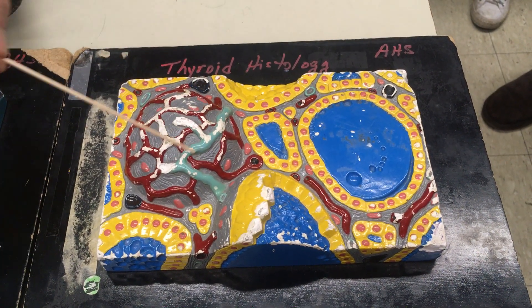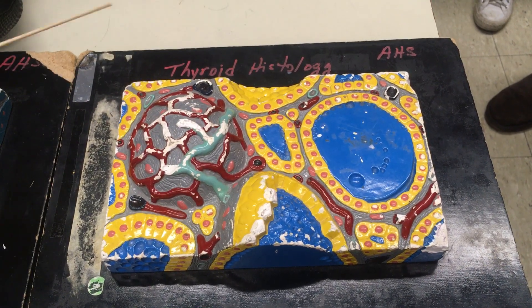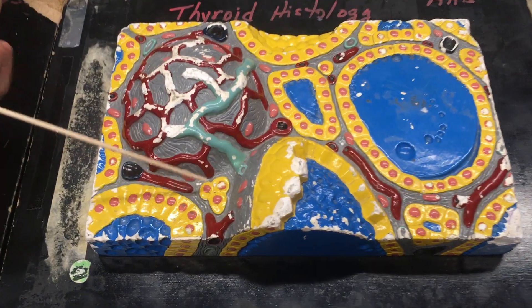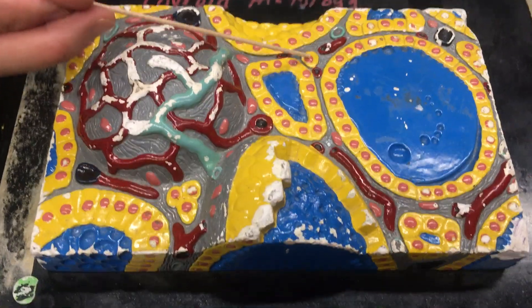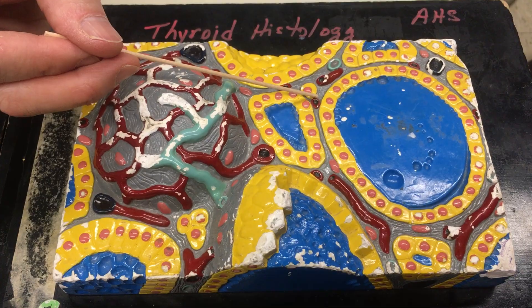This is a lymphatic vessel. The other important thing on here — these cells are C-cells, and they produce calcitonin.